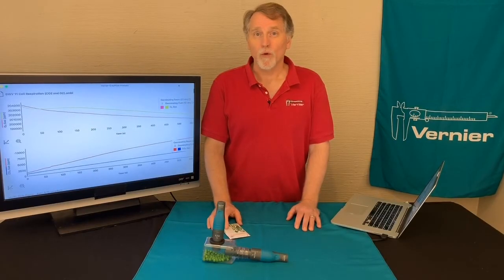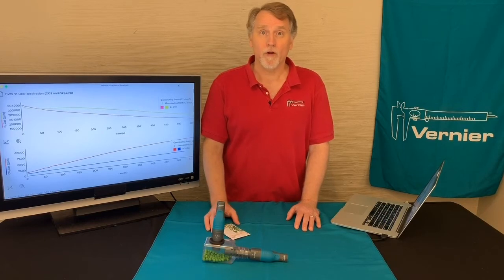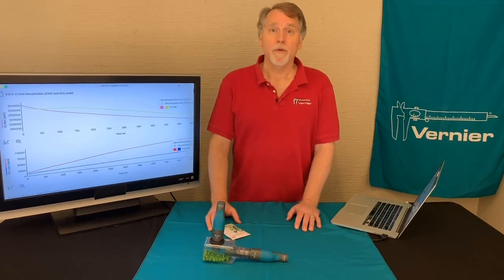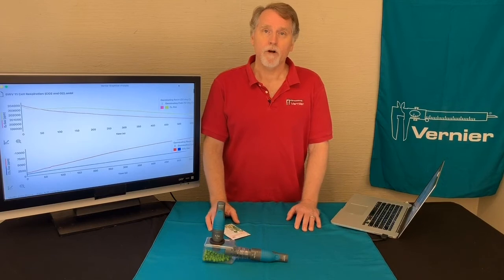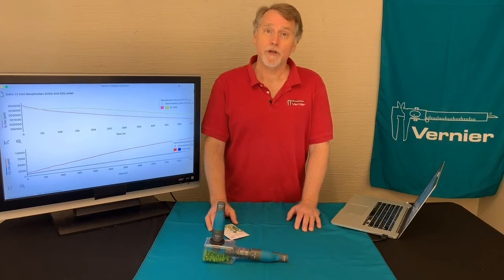Have you ever wondered what happens to a seed when it's put in the ground? This is very important for farmers and gardeners. And so experiment 11 from Biology with Vernier, Cell Respiration, looks at what happens to seeds as they germinate.